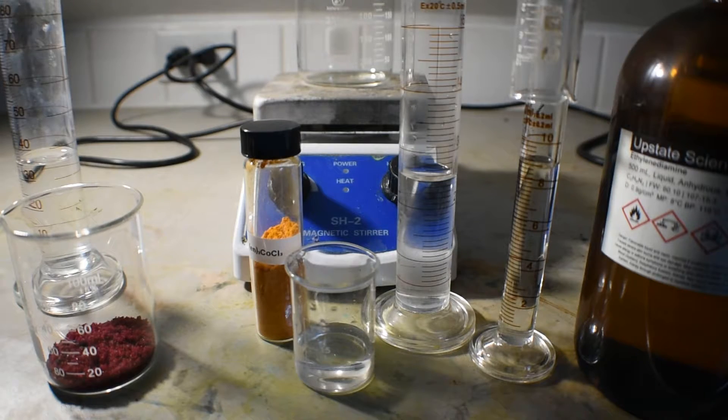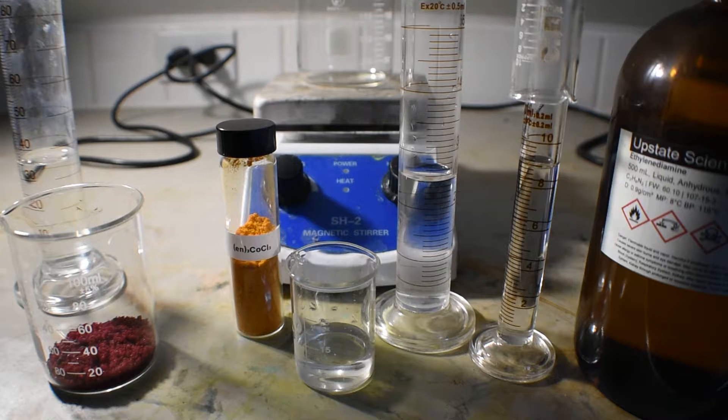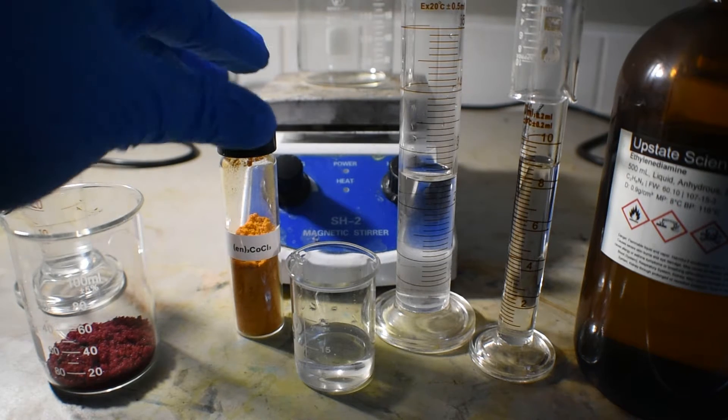Hello everyone, welcome back to another video. Today's synthesis is going to be of tris(ethylenediamine)cobalt(III) chloride. It's a nice orange-yellow solid, which you can see in this dram vial.